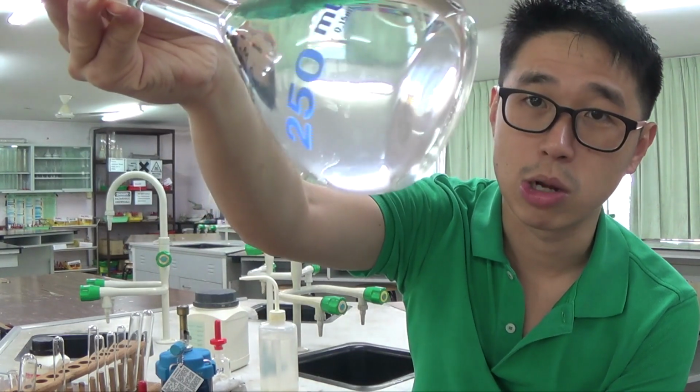When the water evaporates, the saturated solution will start to precipitate out. Calcium hydroxide being a group 2 hydroxide, the earlier the group 2 hydroxide is, the less soluble they are. So preparation of saturated calcium hydroxide for your lime water in the lab has a very specific preparation, because it's not like this where they remain completely soluble.